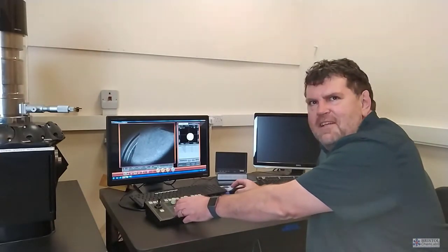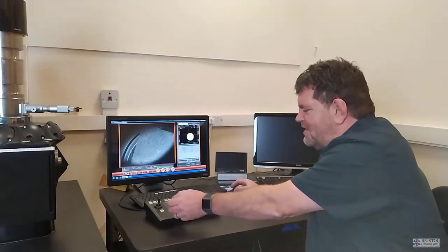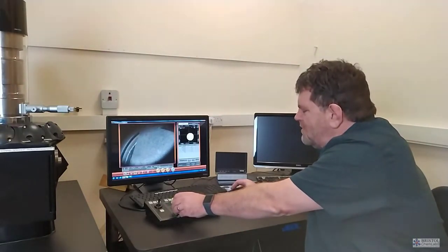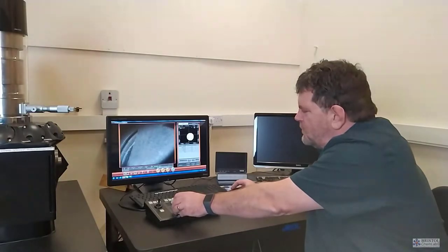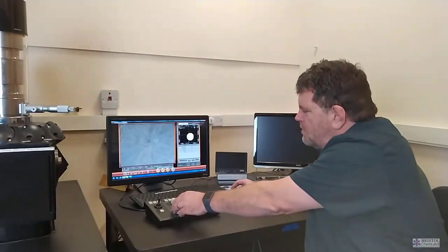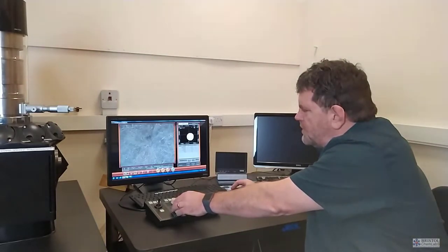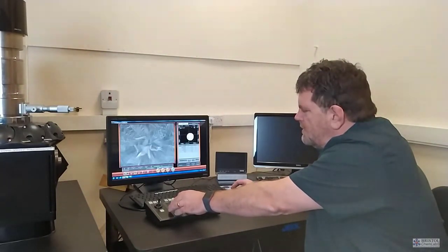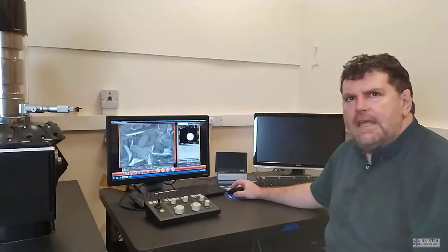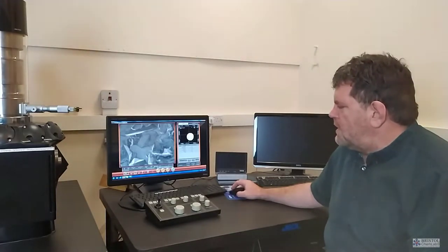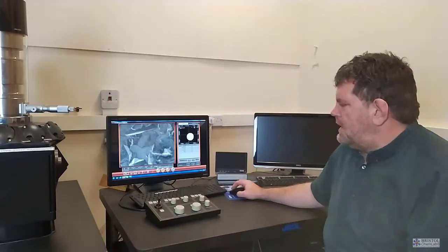The advantage of a scanning electron microscope is just the ease of operation. We literally just have to turn the dial and we're zooming into the sample. We're already at 50 times, zoom into a hundred times and we can keep going in this case until we reach a thousand times. The image is blurry because it's out of focus, but the green bar you can see is 10 micrometers or 10 millionths of a meter.